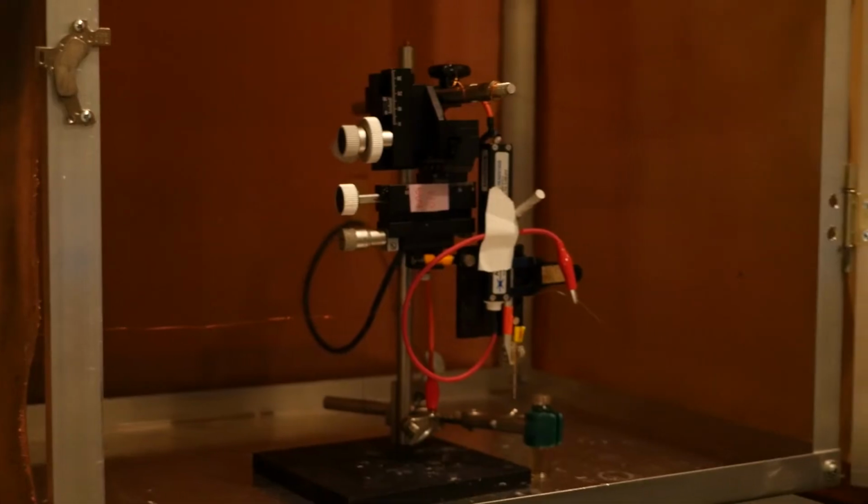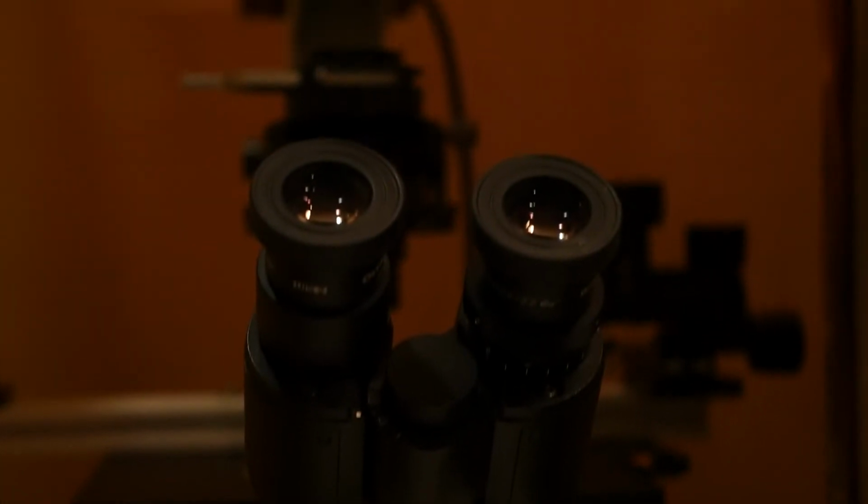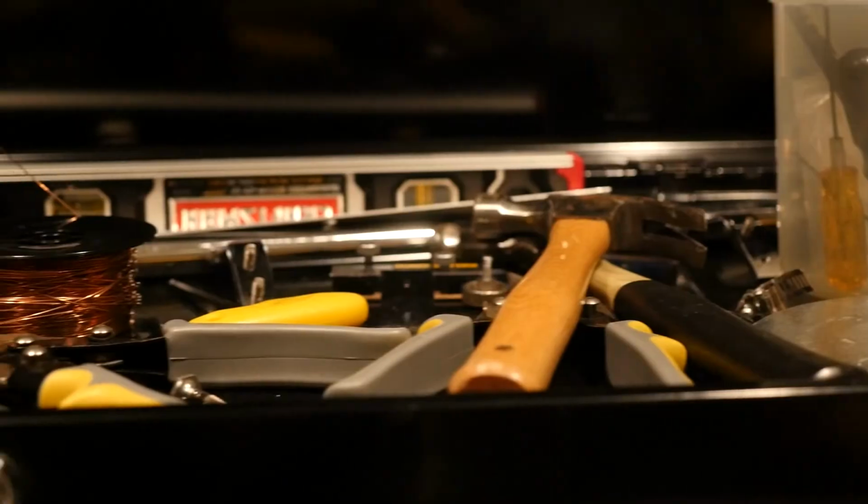This is the amperometry room, where a lot of fundamental research in our lab gets started. By using that fundamental knowledge, we're able to transition to more applicable projects. For example, we're trying to develop new electrochemical-based biosensors to detect the COVID-19 virus. We're currently in the fabrication room where much experimentation begins.